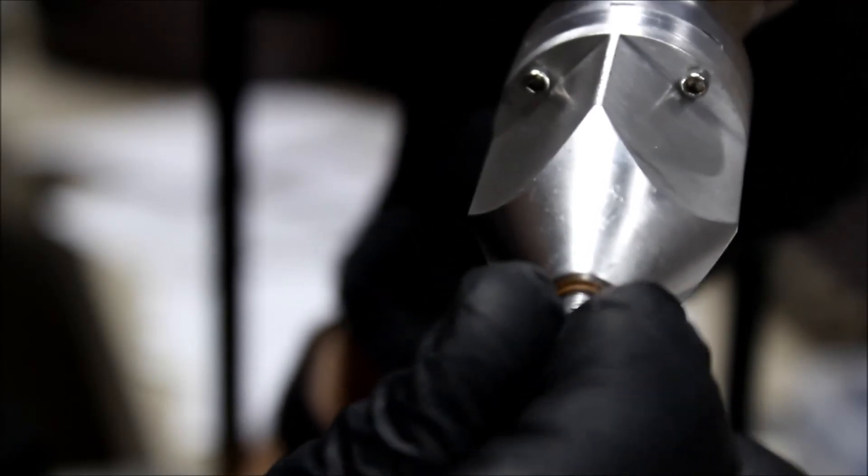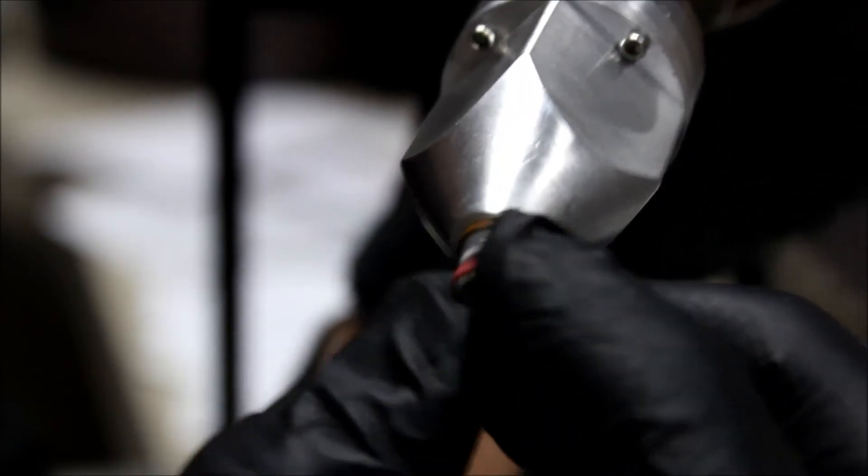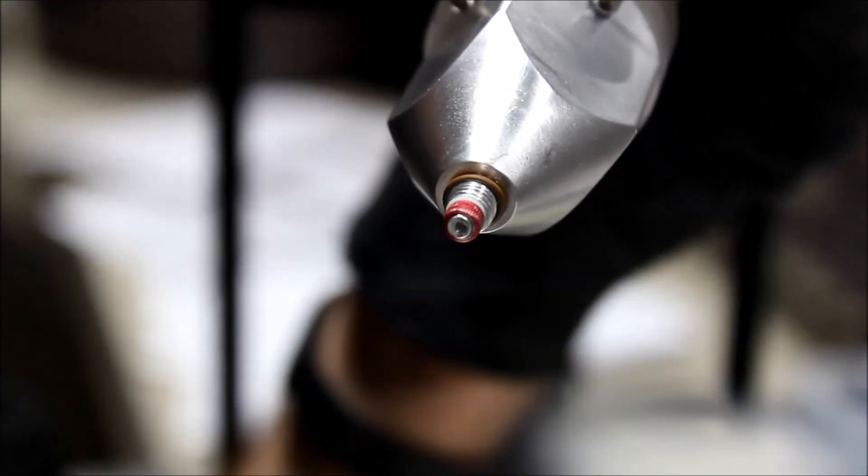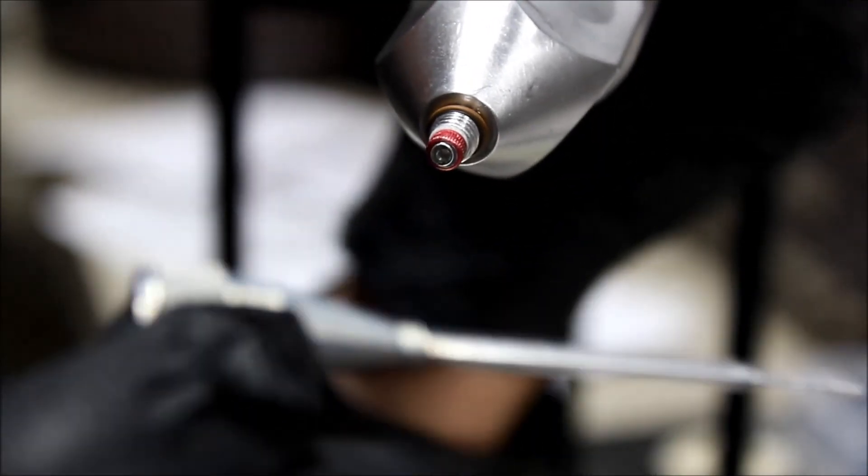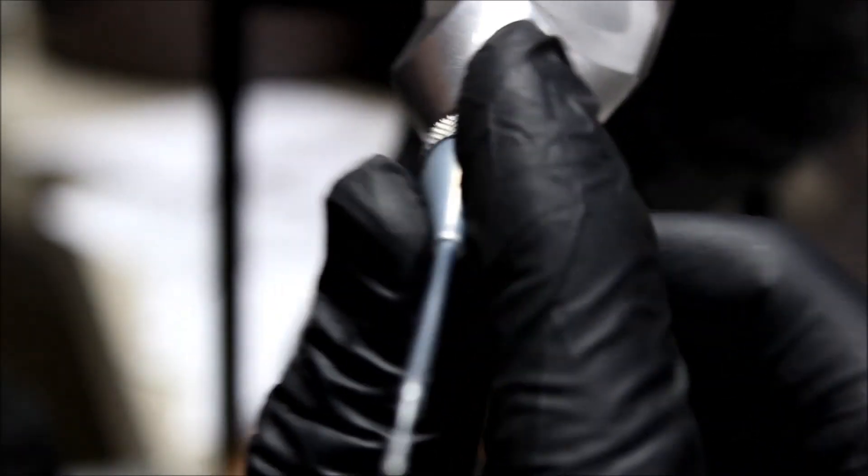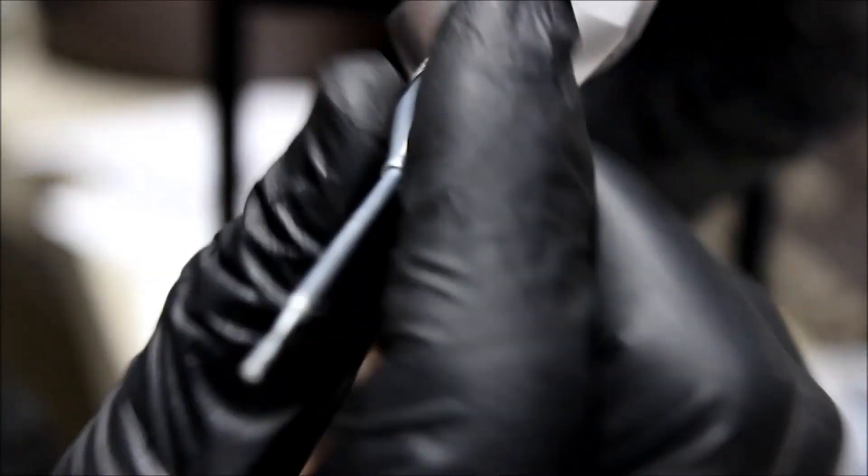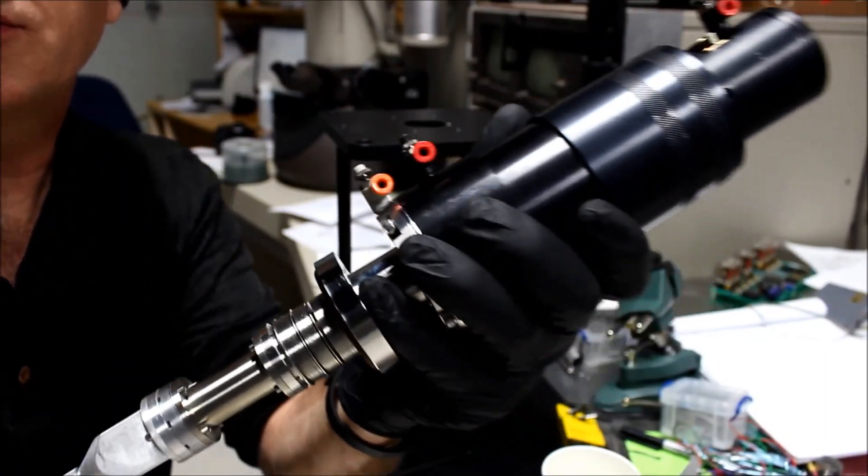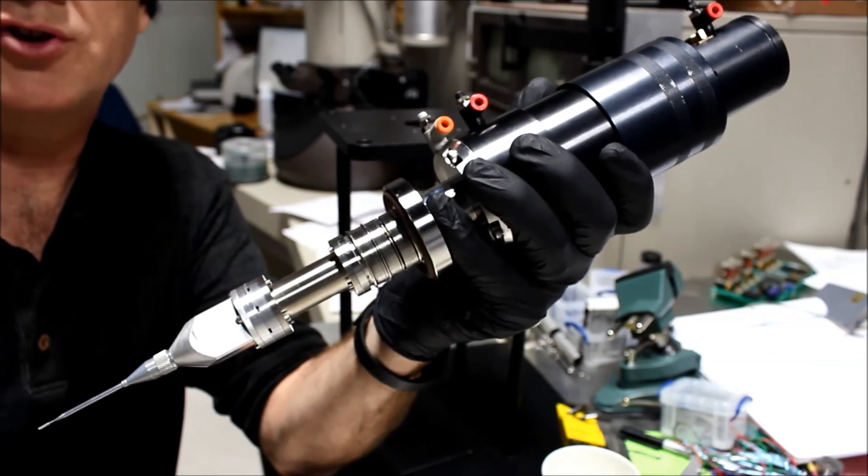We can replace the flow control aperture, and we can replace the needle, turning it clockwise. And here is our refilled and completed gas injector, ready for installation on our FIB.